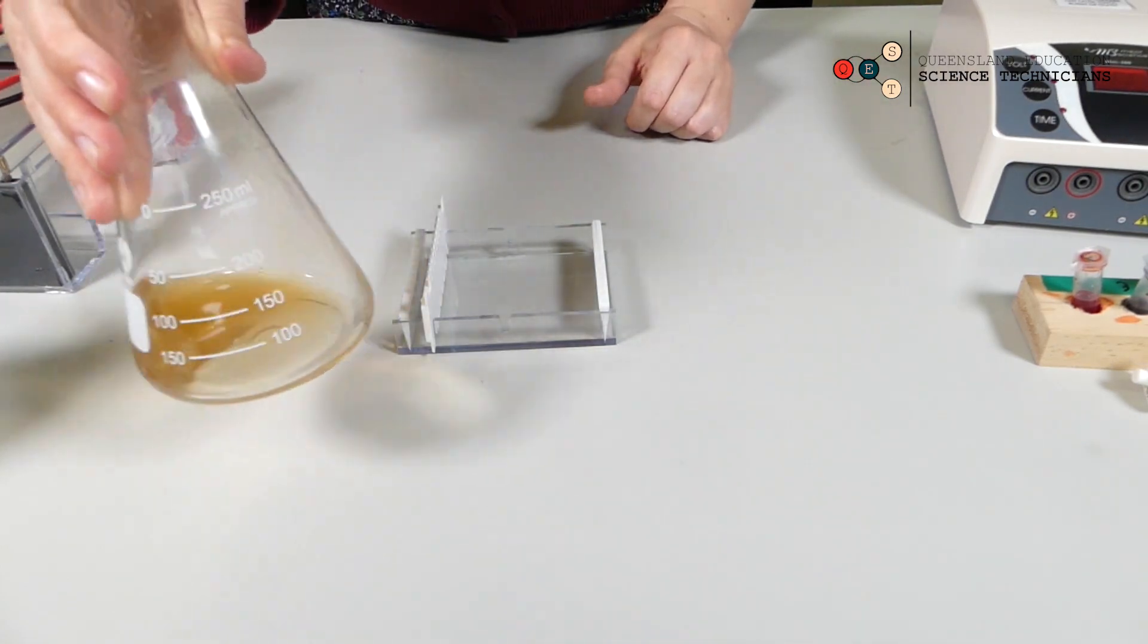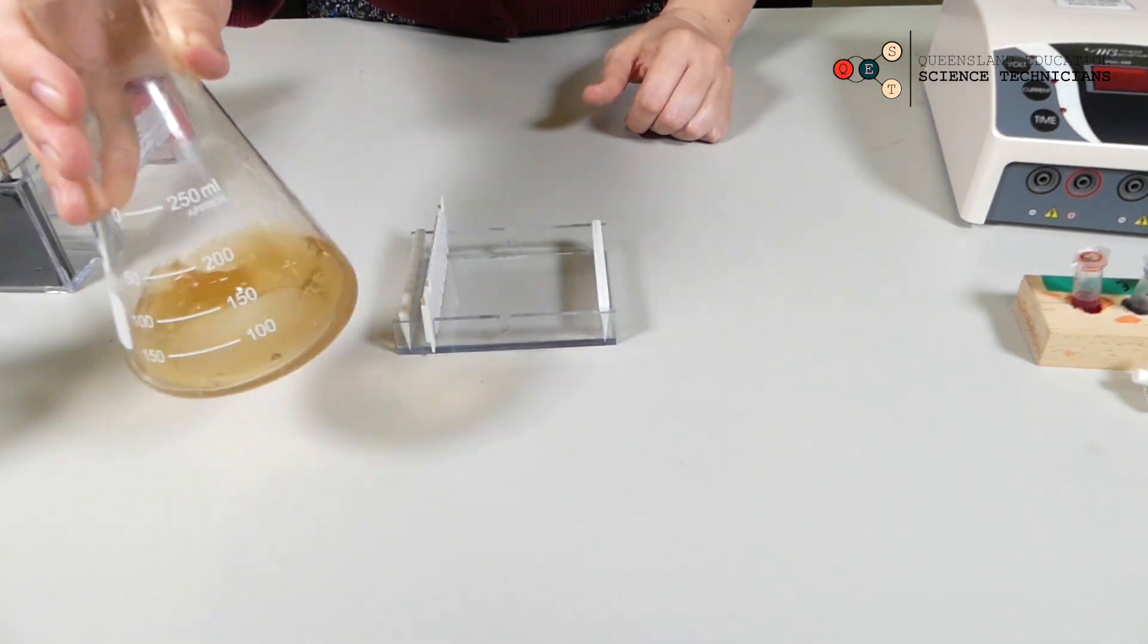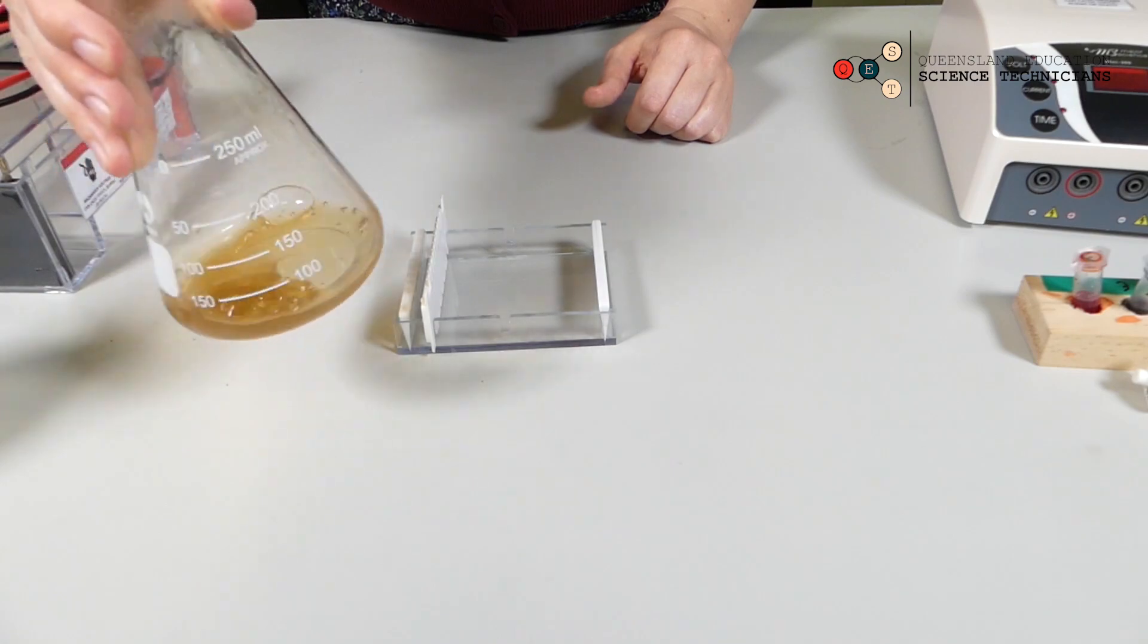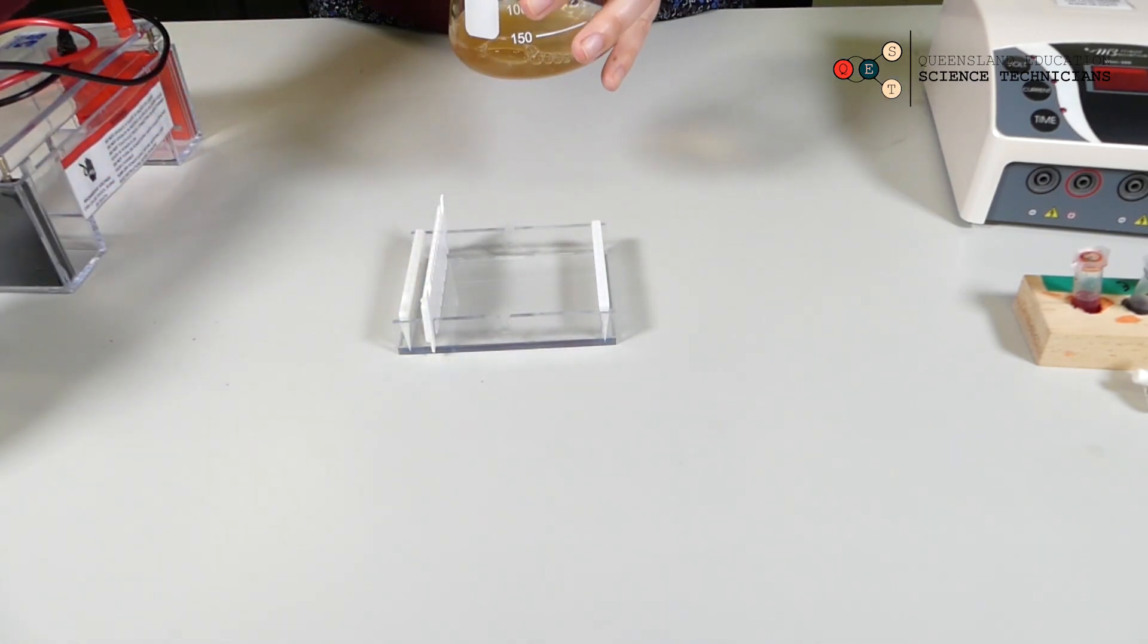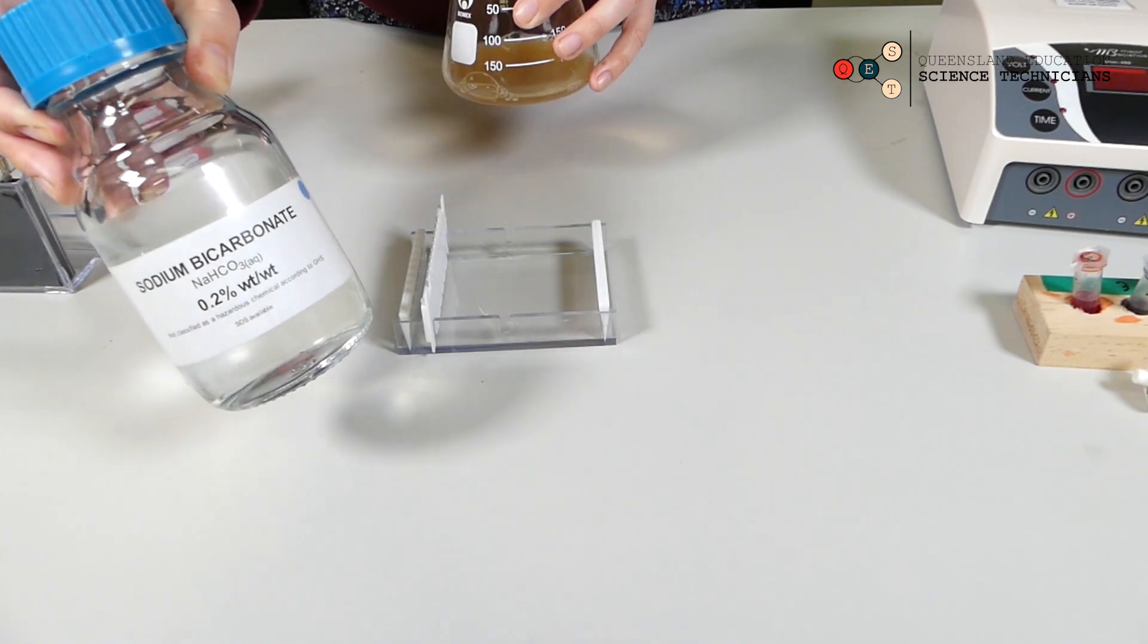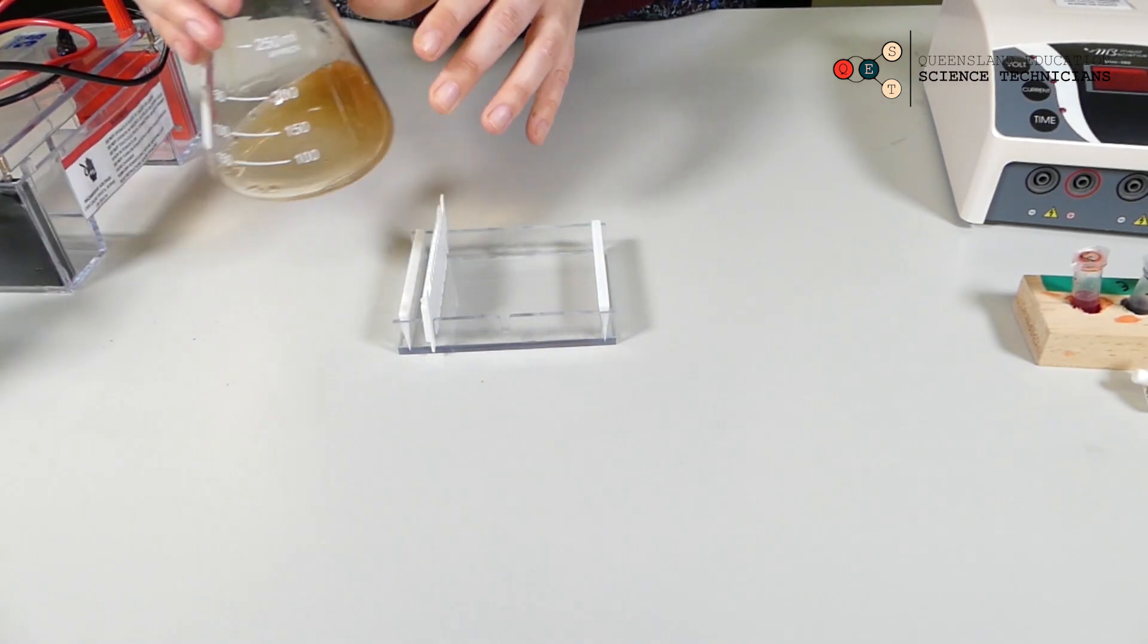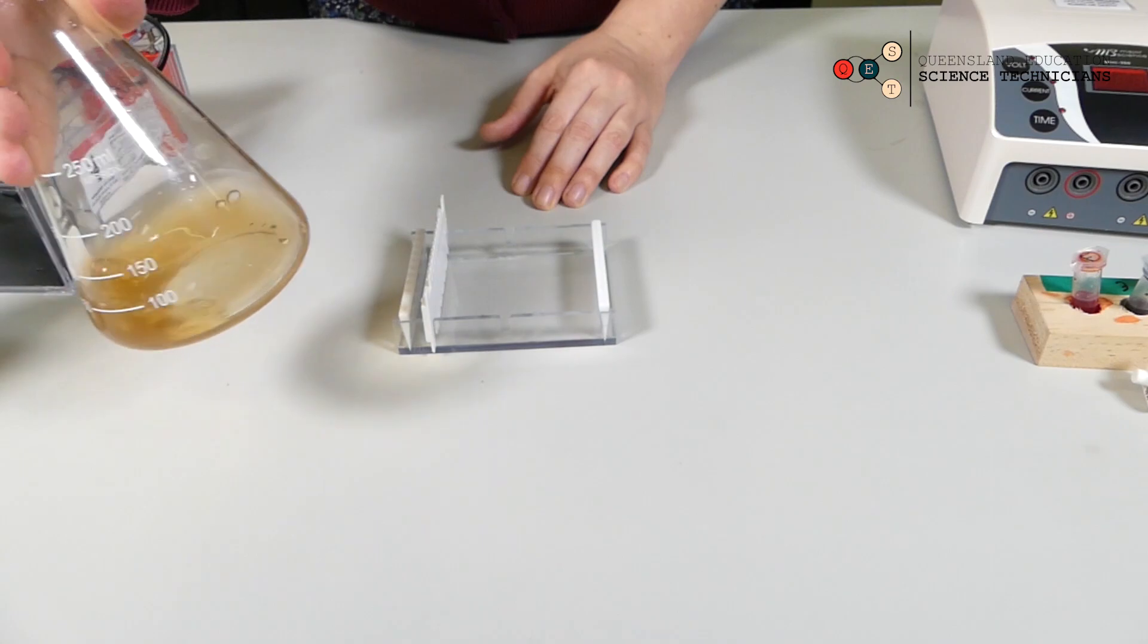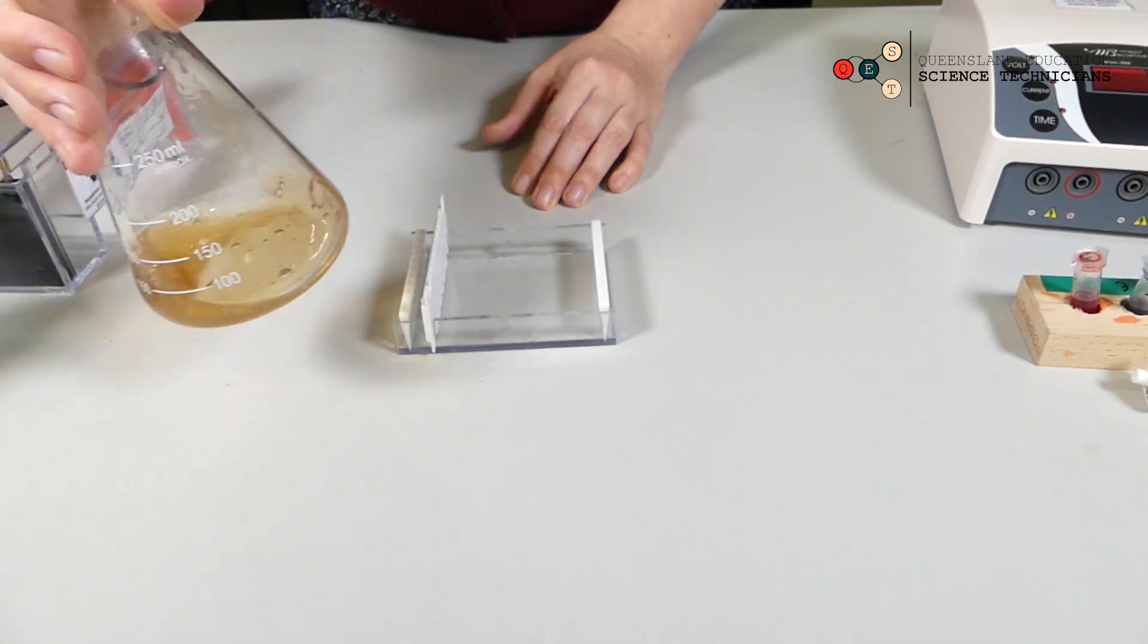Now I have some agar I've made up. This is 2% agar made with a 0.2% sodium bicarbonate buffer solution. This has been heated up and allowed to cool to about 60 degrees.